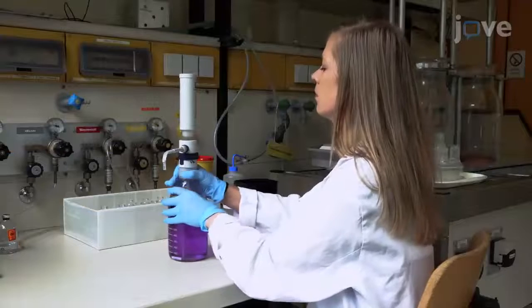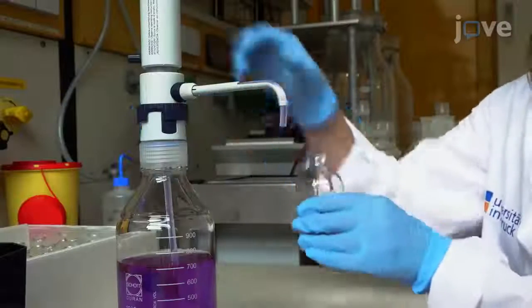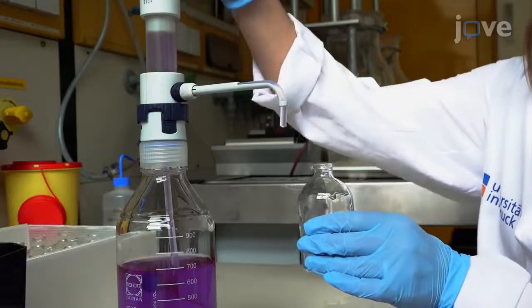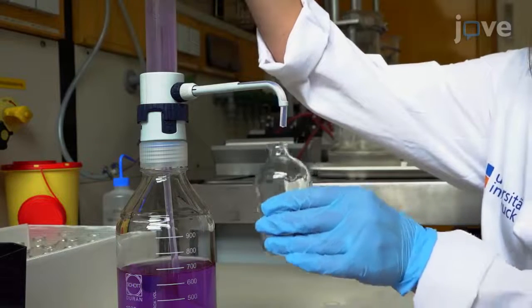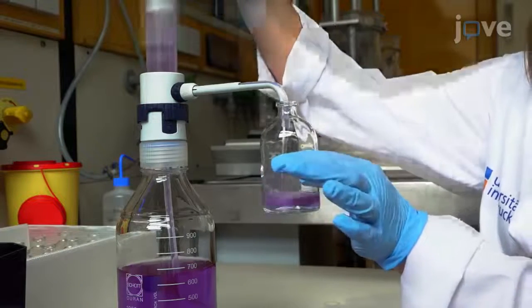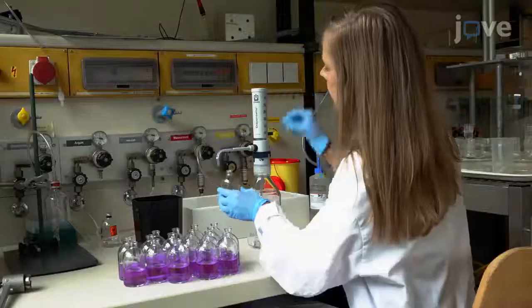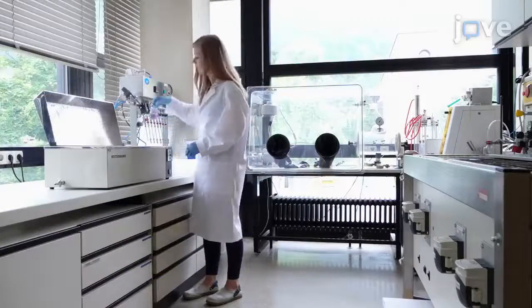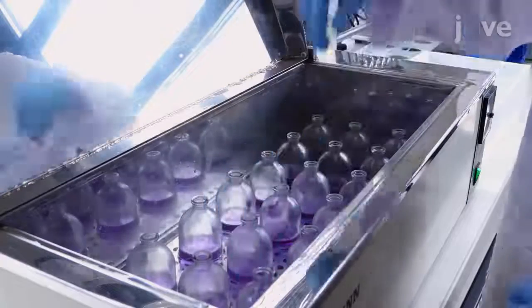Fill 120 ml serum flasks with 50 ml of medium, then incubate them in a 100 degree Celsius water bath for 20 to 30 minutes to reduce the solubility of oxygen in the liquid phase.